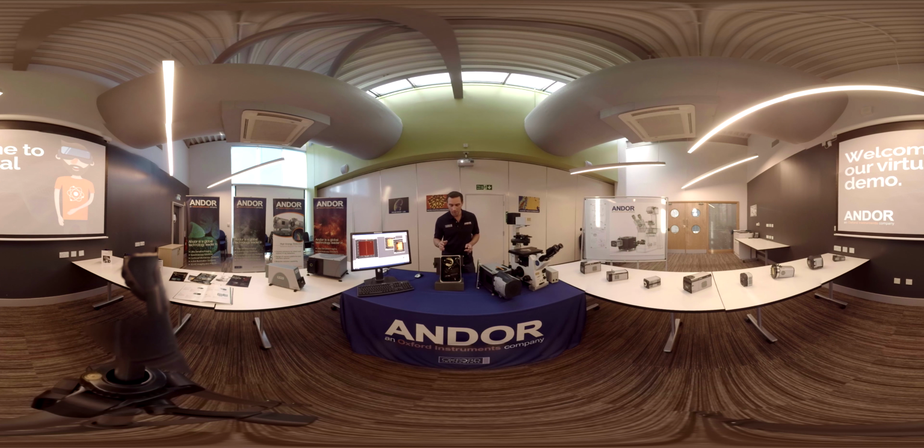And also, every spectrograph that has multiple configurations of grating and port will have very slightly different focal points for each of those, which means a slightly different focus. And when those systems are QC'd, the best compromise focus position has to be held for the camera. Whereas in the 193, the software will automatically adjust for each of those configurations and give you the best performance. So there's no need to compromise.